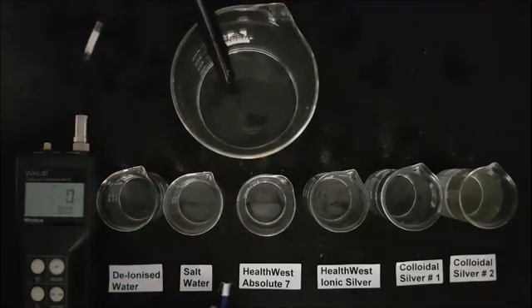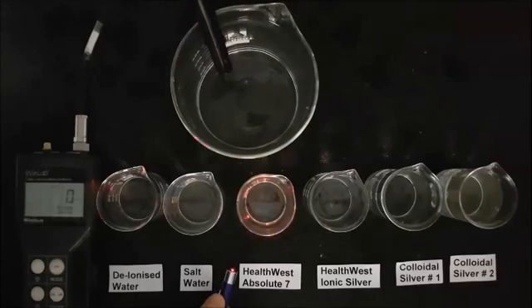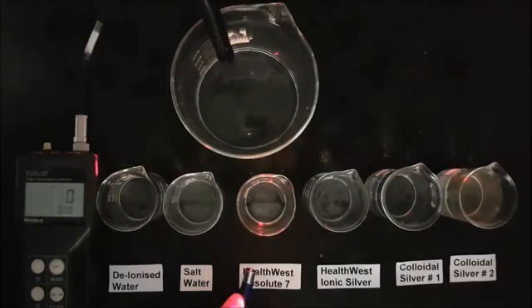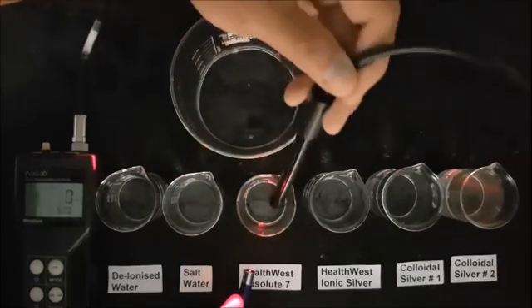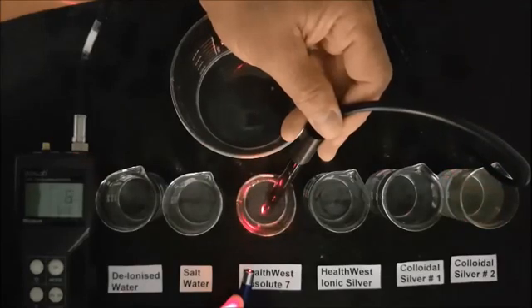As we move to the next beaker containing Absolute 7, we can also see that there is no Tyndall effect even though it contains ionic minerals with a conductivity of six parts per million.